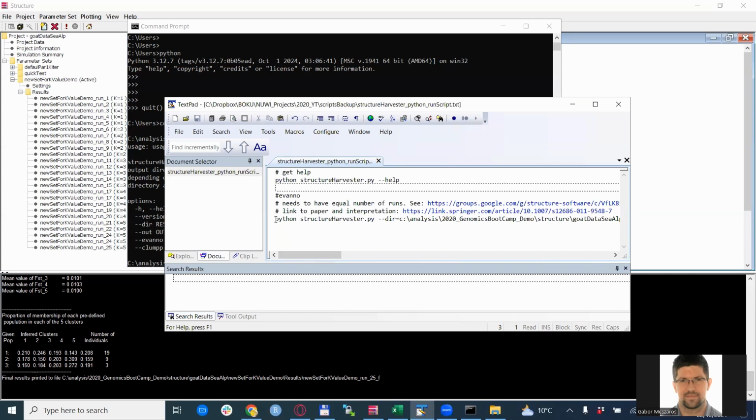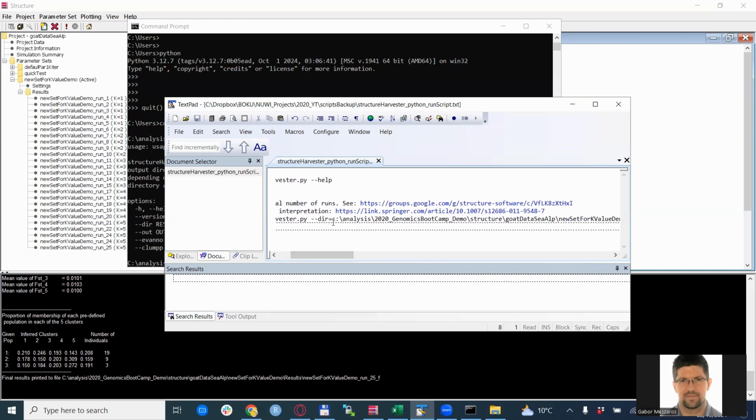This is actually the last line here, which is the relevant one. We start the same way as before, python structureharvester.py, then --dir=, and then I put the full path to the structure results. So maybe a bit more detail on this.